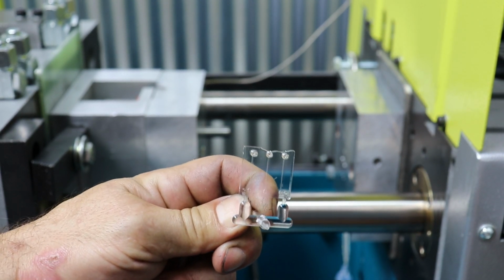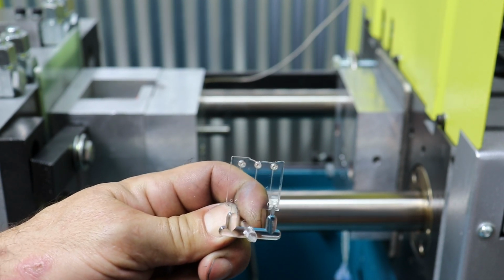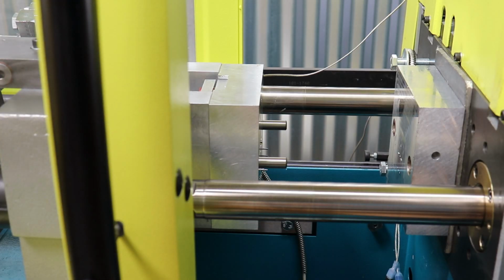It should be a nice square edge. So I've got to do a little bit of process development to figure out what to do about all this, and I'll be back in a second. I think we'll tackle the two problems separately. The first is to get a full fill.